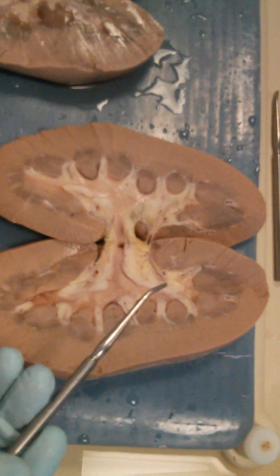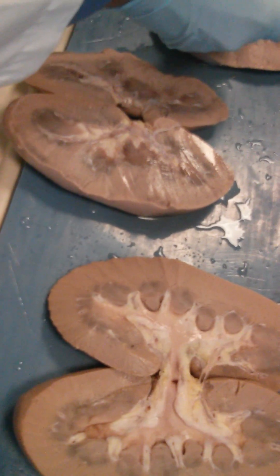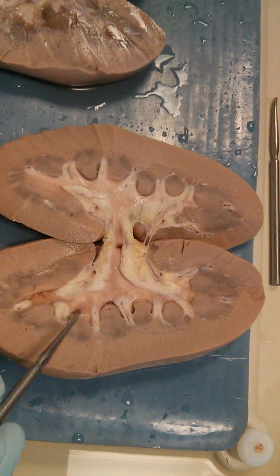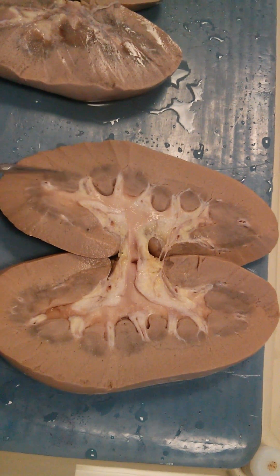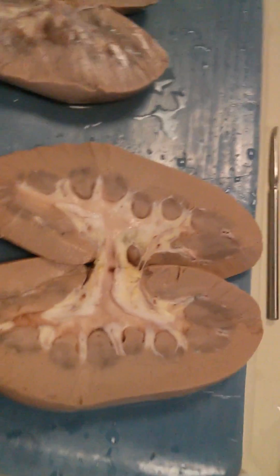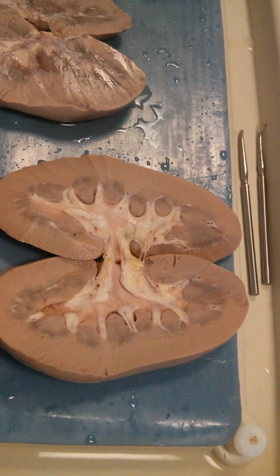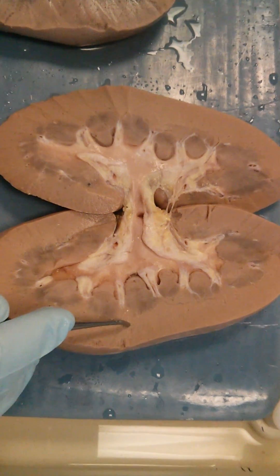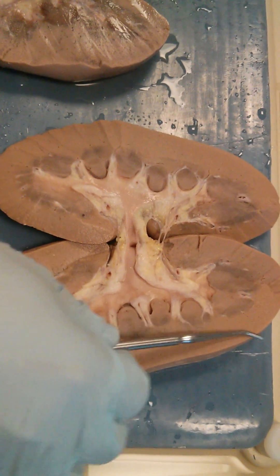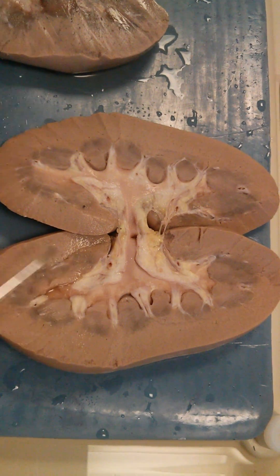These here are the renal pyramids. Each has a base and a tip — base and tip. That is the renal pyramid. If you look closer under the microscope, you will see straight lines, because these are either the loop of Henle ascending and descending, or the collecting tubules. The renal corpuscles are located in the cortex — all the distal convoluted tubules, proximal convoluted tubules — everything is in the cortex. The medulla has just the straight tube extensions.